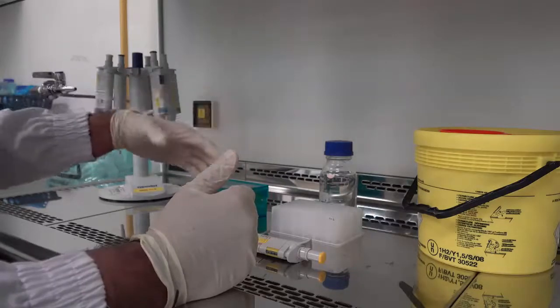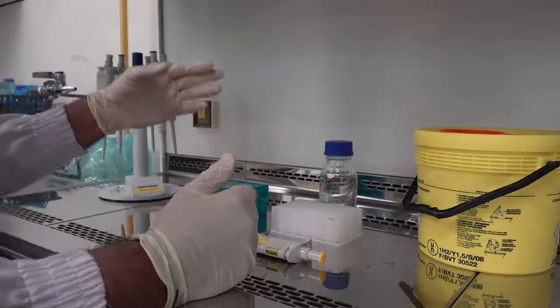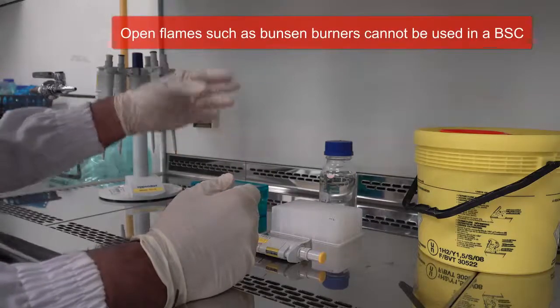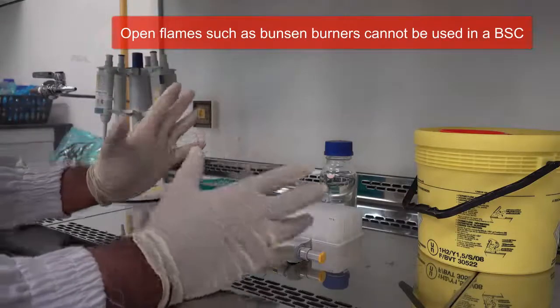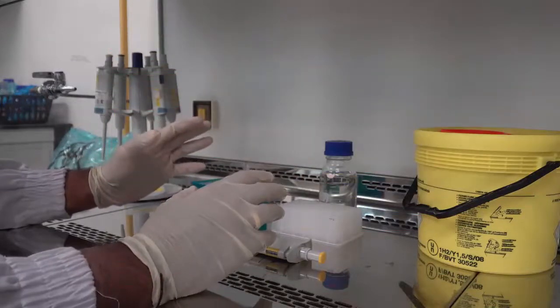There are some things which you cannot do in a biological safety cabinet. For example, the usage of open flames is not permitted as the flame will generate a convection current which can disturb the flow of air in this biological safety cabinet.